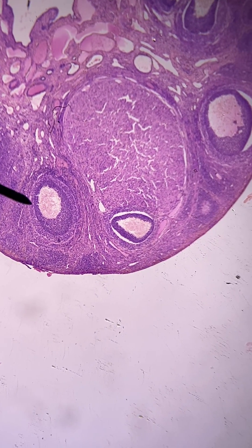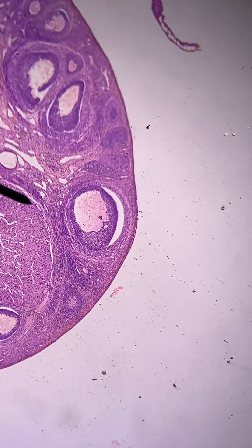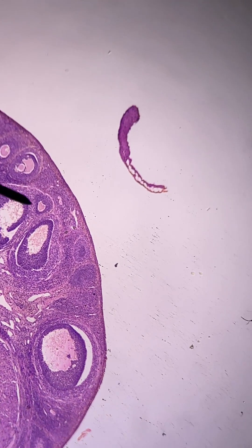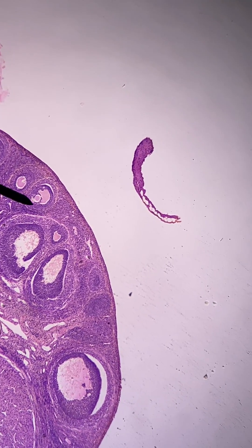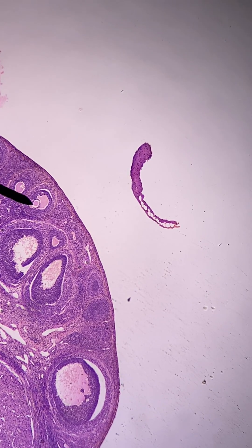You don't see the oocyte necessarily in everyone because you don't always chop it through the right way. But we can see an oocyte way up in there — right there it is.